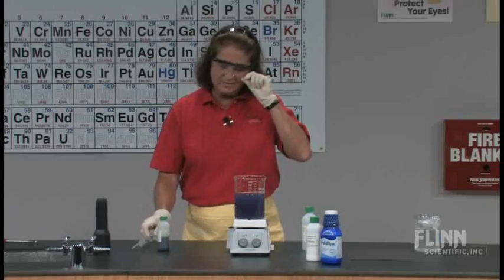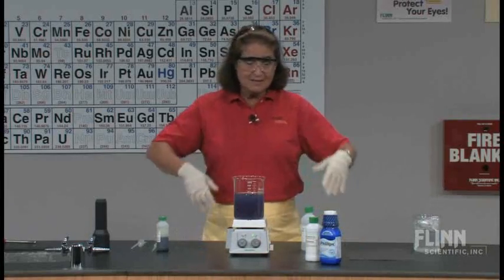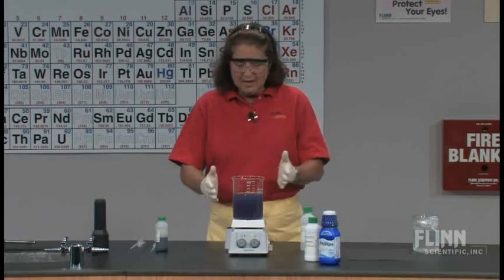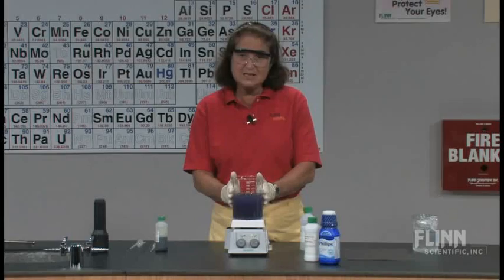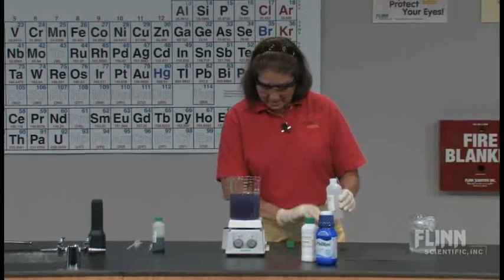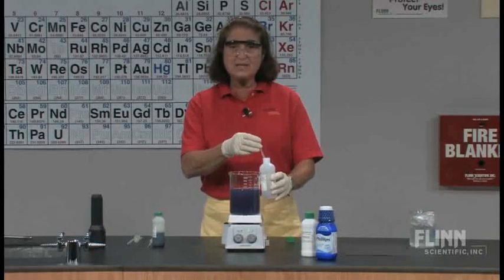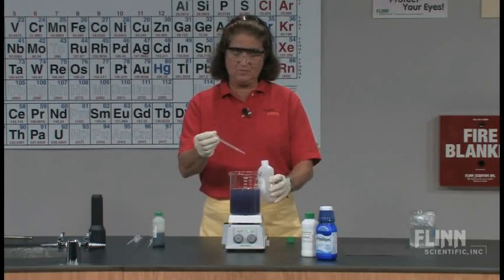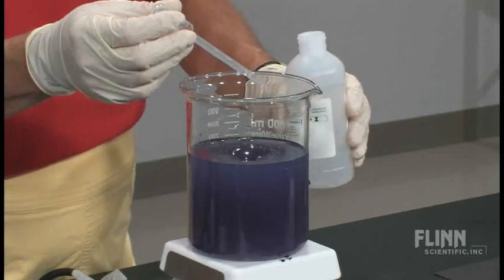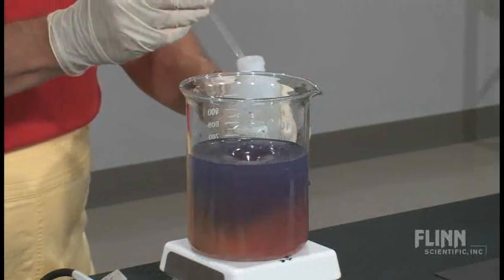What is the purpose of Phillips Milk of Magnesia? We use it to neutralize acids when we have acid indigestion. So since I have the magnesium hydroxide here, I'm going to do the reverse reaction. I'm going to add 3 molar hydrochloric acid. Here I'm going to be examining acid-base chemistry using an indicator and changes in pH. Let's see what happens when I've had some acid indigestion — here comes the culprit: just a couple of drops of 3 molar hydrochloric acid.